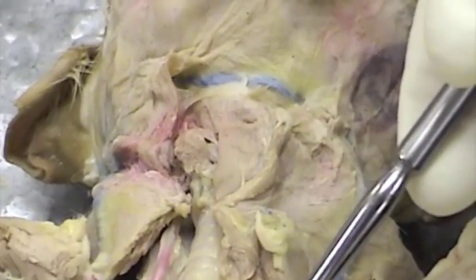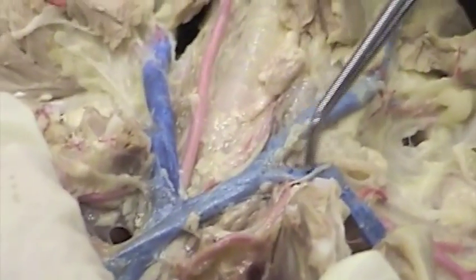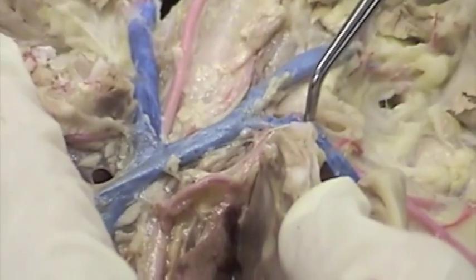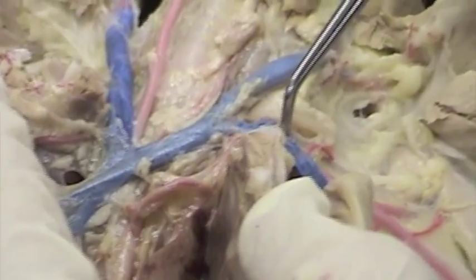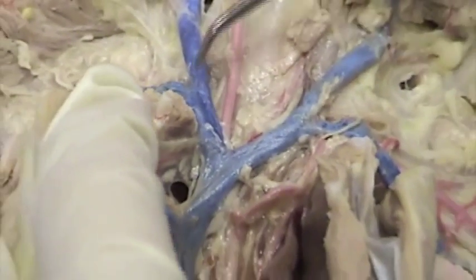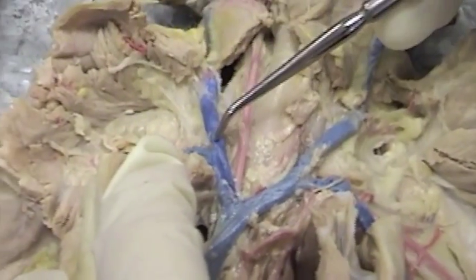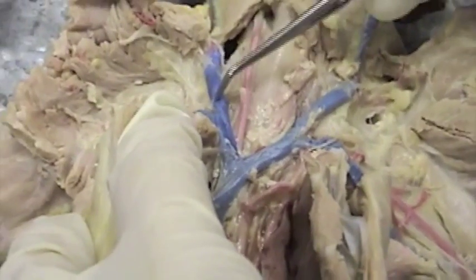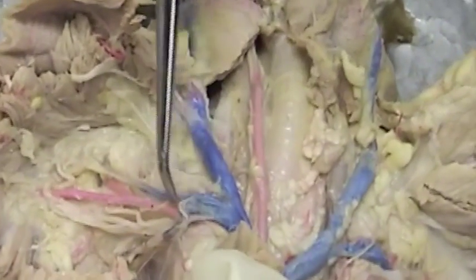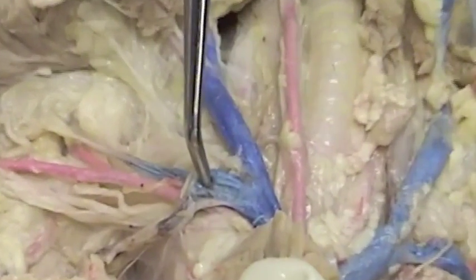Let's go back to the subclavian. The subclavian vein is the subclavian until the next division, and we can see that best on the other side. So we're going to move over here, find our landmarks. Here's the brachiocephalic to the division, and after the division, we have one part that is the external jugular, and over here we have the subclavian. This is the right subclavian vein.